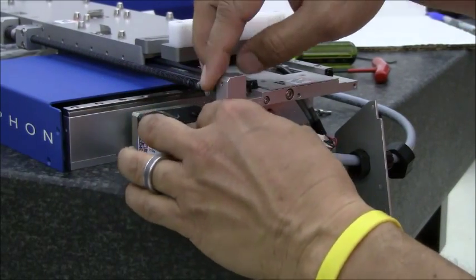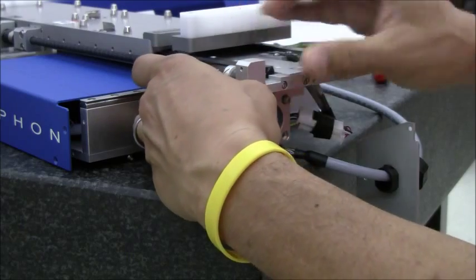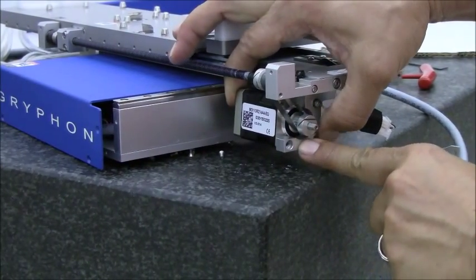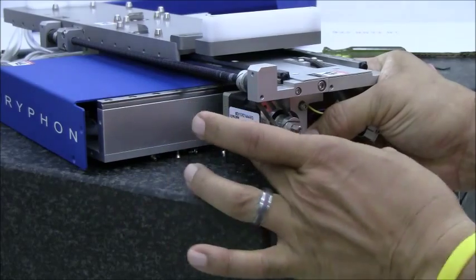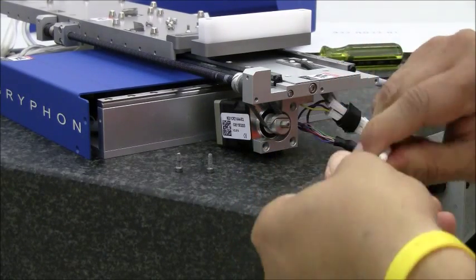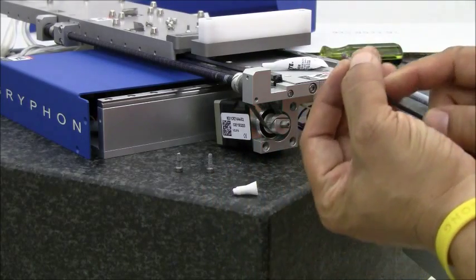Now you're going to pivot the motor into place by placing it into the pulley belt, ensuring that the collar on the motor fits snugly into the cutout on the bracket.